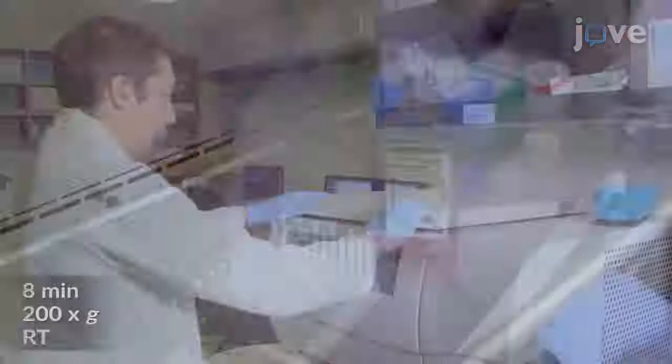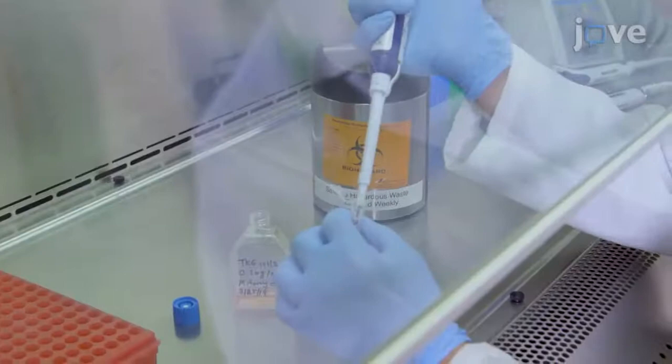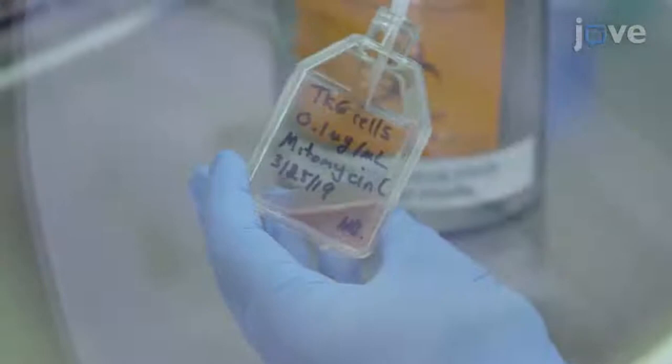Collect the cells by centrifugation and resuspend the pellets in 10 mL of fresh culture medium per tube for seeding in new T25 culture flasks. Then add 150 µL of the stock concentration of cytochalasin B to each flask to achieve a final concentration of 3 µg per mL.